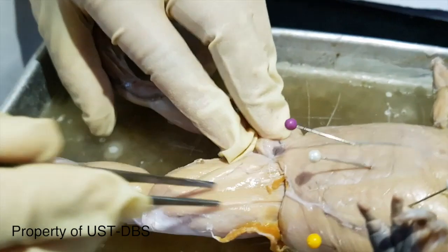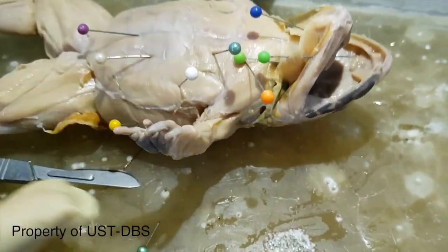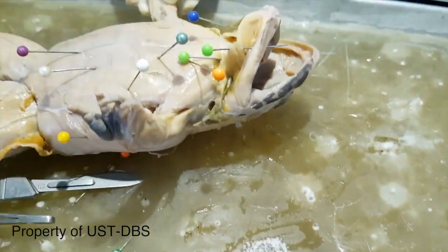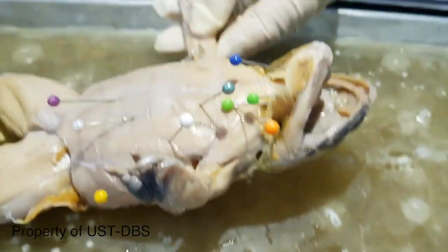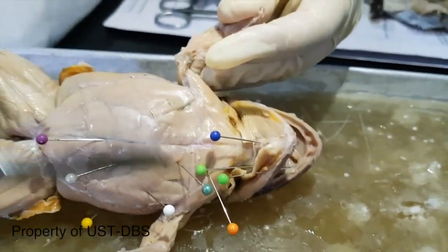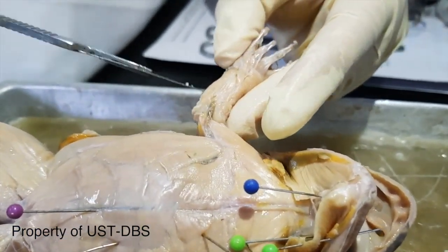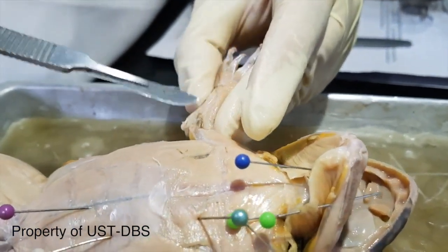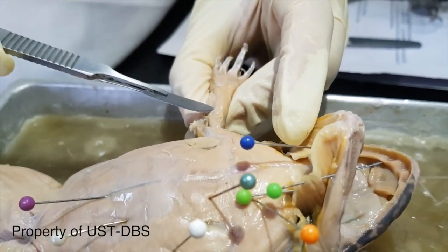Then we move on first to the arms. So the dorsal side is the extensor group, and the ventral side is the flexor group of muscles. On the same basis, at the elbow, that's the ulna side. So this is the flexor carpi ulnaris and the flexor carpi radialis.